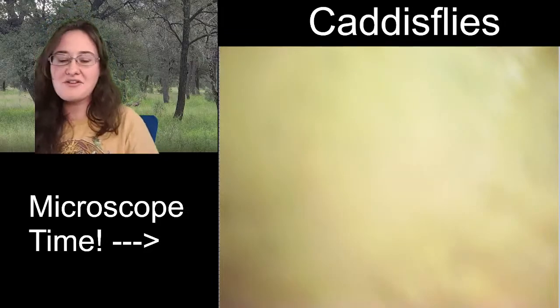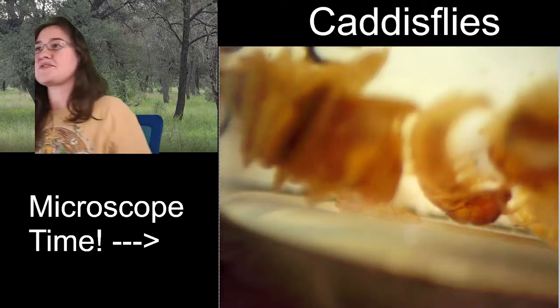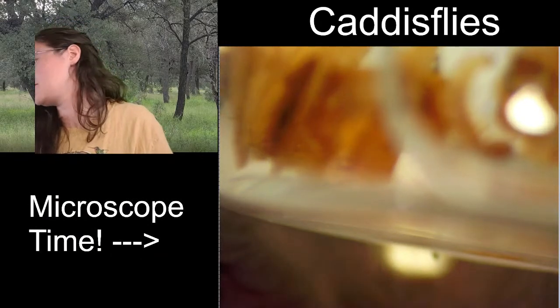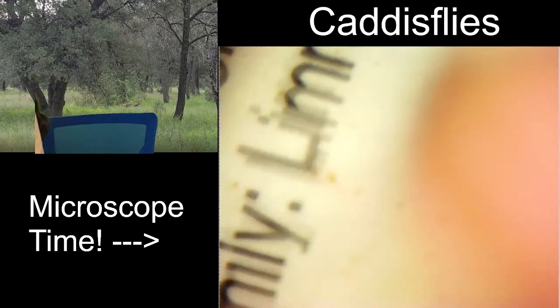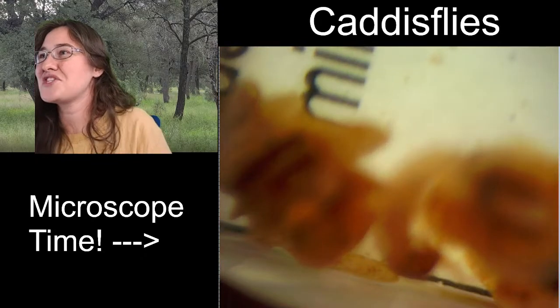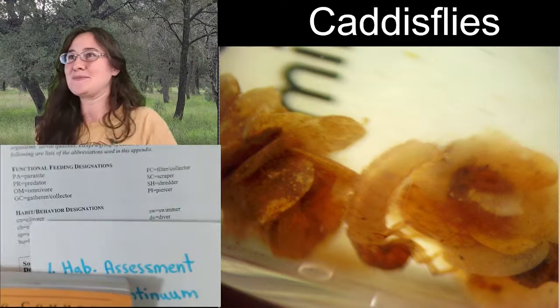All right. Other than our caddisflies, I'm gonna leave it on there when we go to the next one. Oh, it overfocused. Where'd the bubble go? No, we don't want the bubble. I wish I had my aquatic collection from the one I turned in from school. That would have been awesome. I don't have that one anymore.